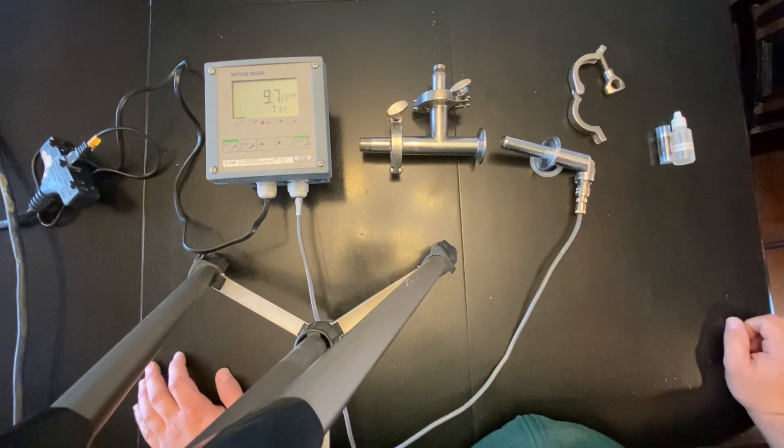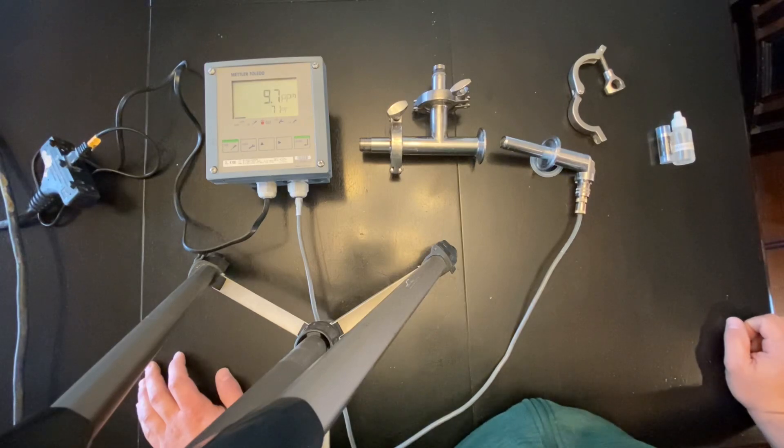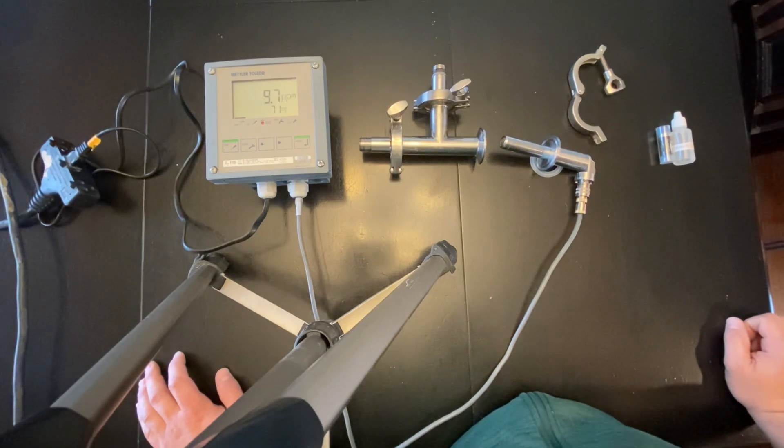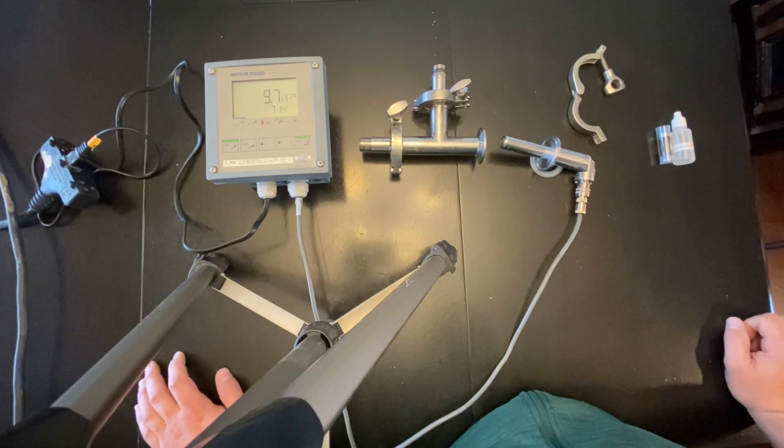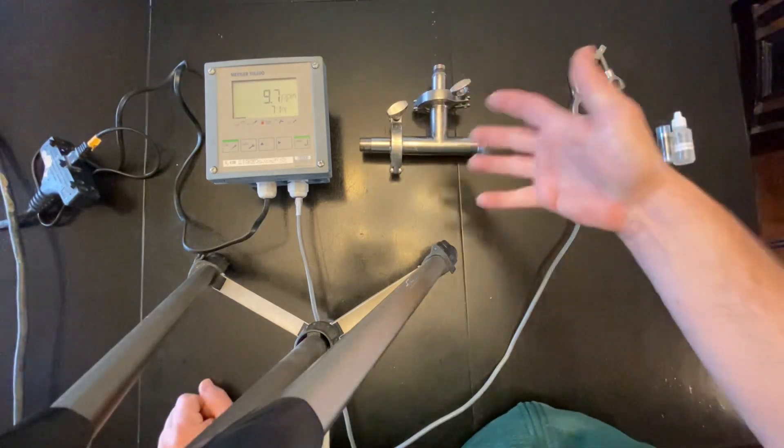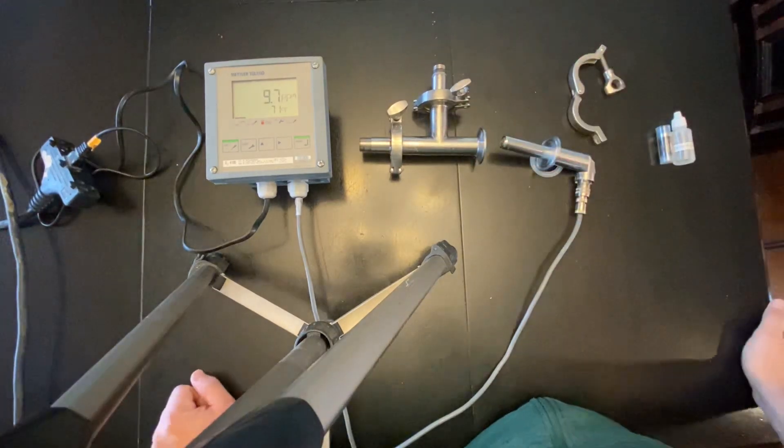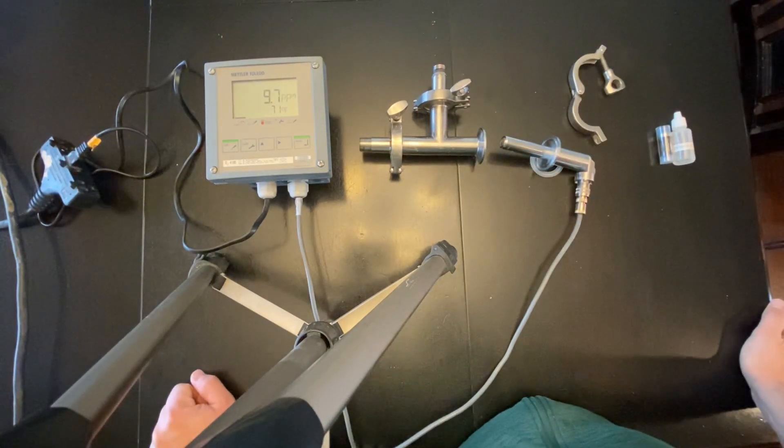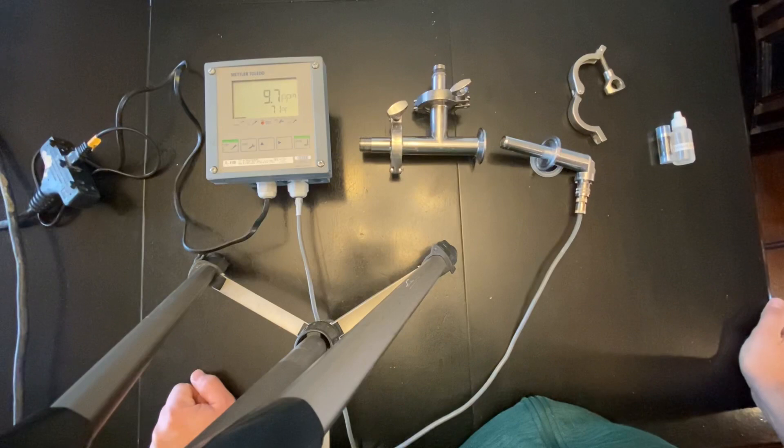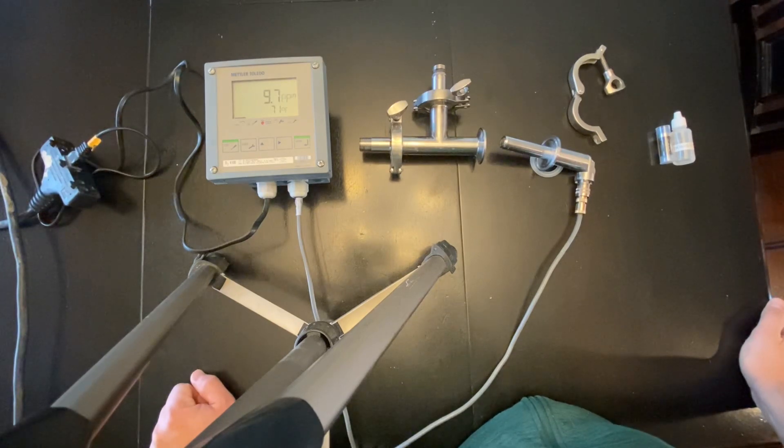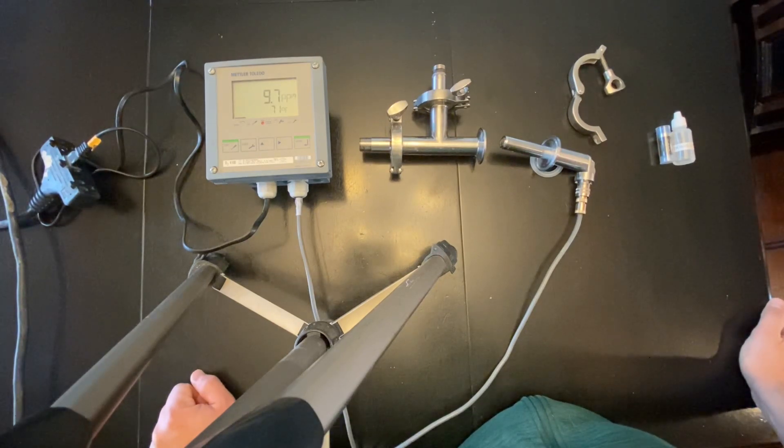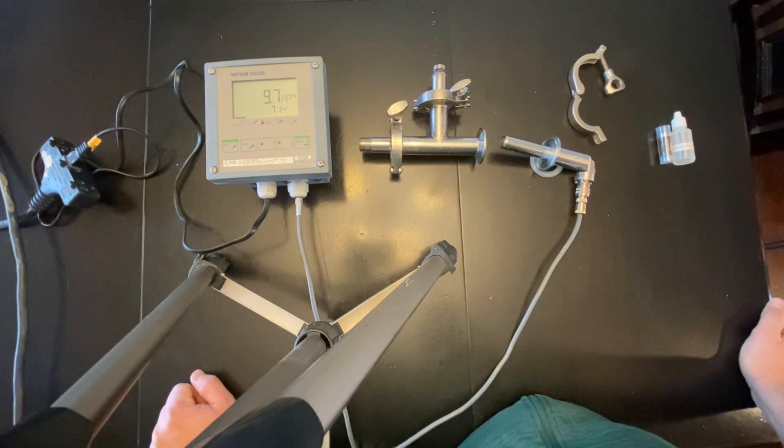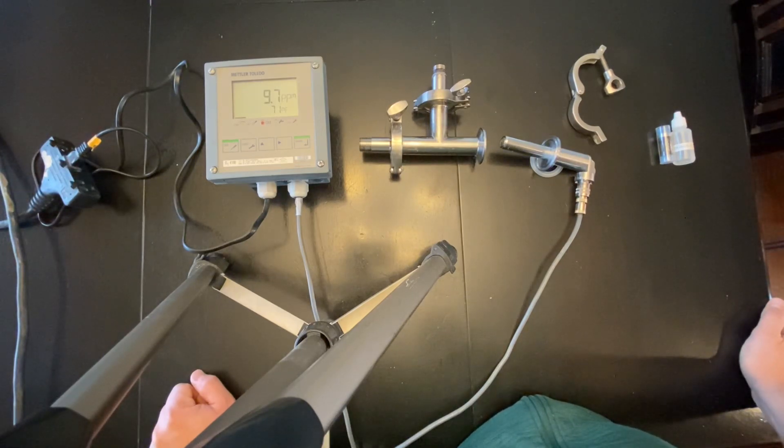All you have to do is just plug it into the wall and this T should give you the fittings that you need and everything should be good. I hope you guys can use this to its fullest capacity and figure out your system and be able to repeat it without any questions or concerns.